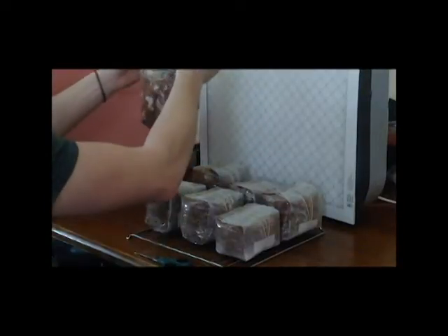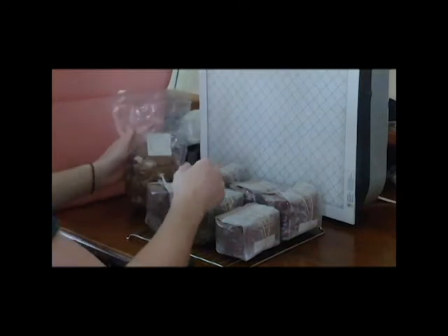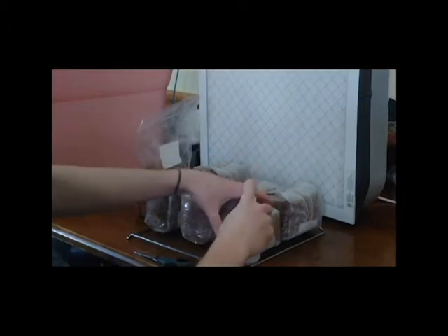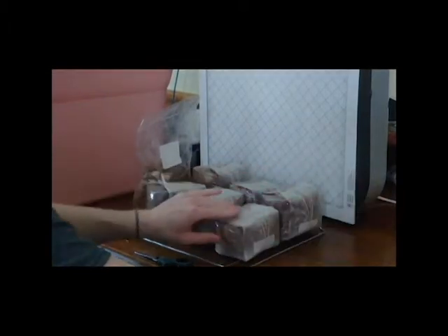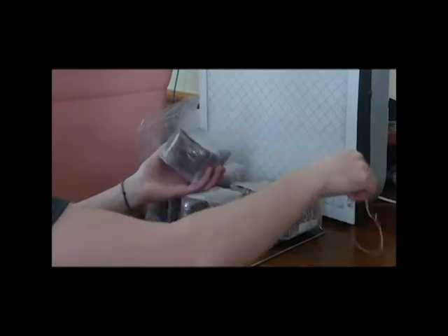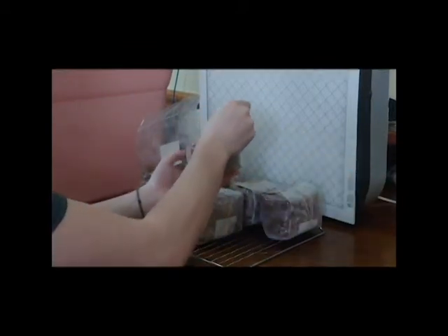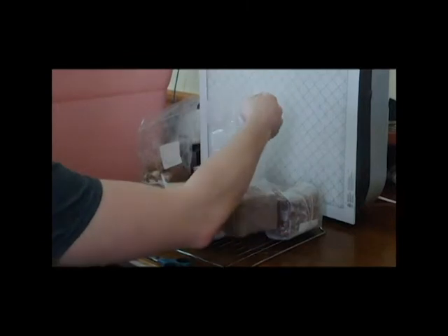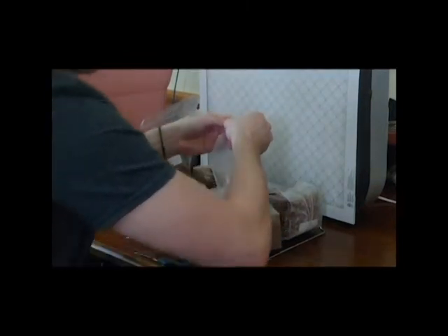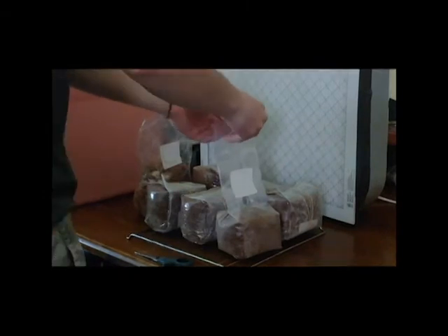Hello and welcome back to our mycology journey. In the last video I posted, I showed myself inoculating six bags with lion's mane culture. Off camera I inoculated just around 60 bags. This video is intended for two purposes: one, to show how well the DIY laminar flow hood is and how much contamination it stops; and two, to show how to put growing bags into fruiting conditions.